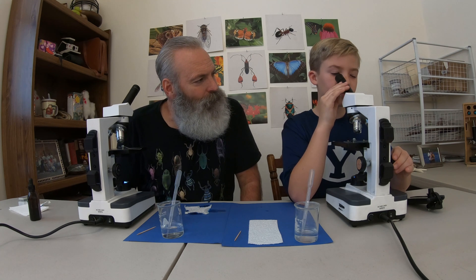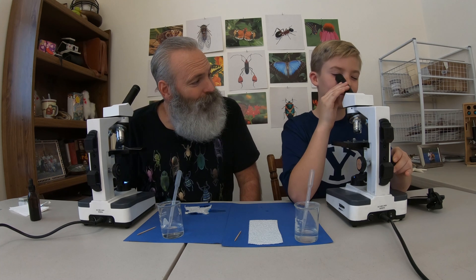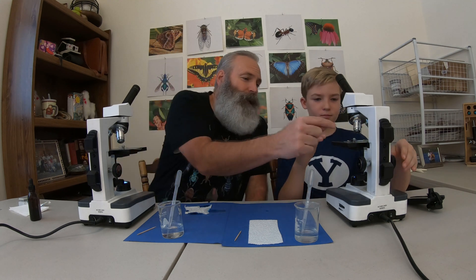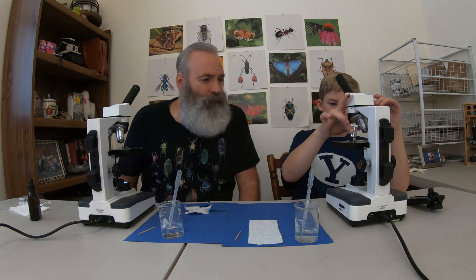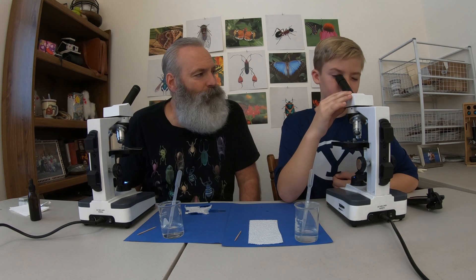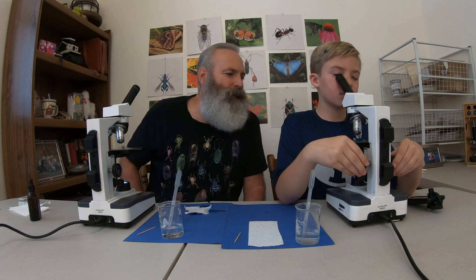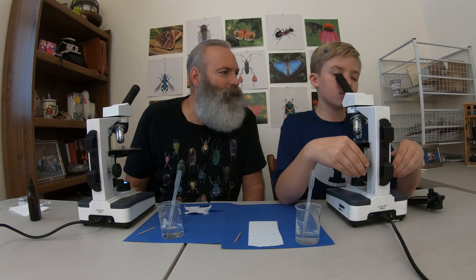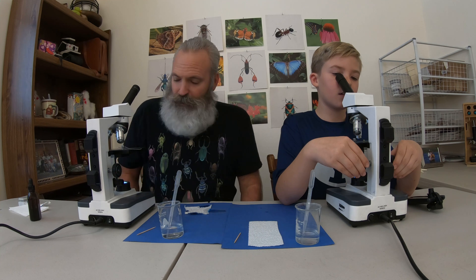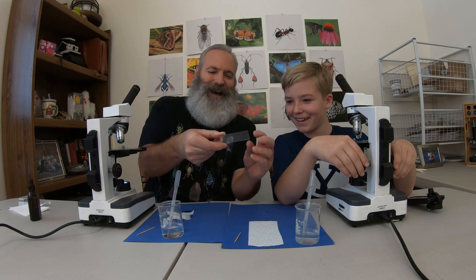What do you think? There is focus — you see some? Yeah! You see actual cells. You know that's part of you. If you want to get closer, we grab this knob and turn that to put the yellow objective in position. Look through there and grab your coarse adjustment knob again and move that until it gets into focus. Pretty sweet? Yeah. So now you should be able to see your nucleus — the dark section.